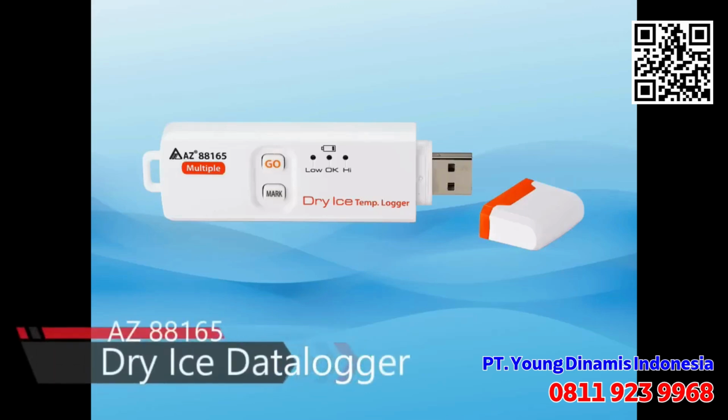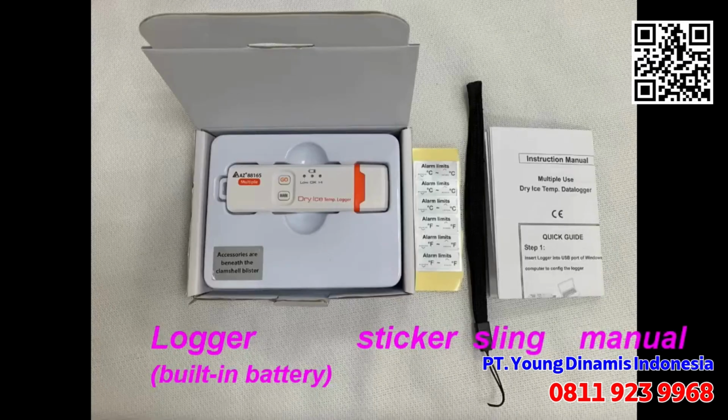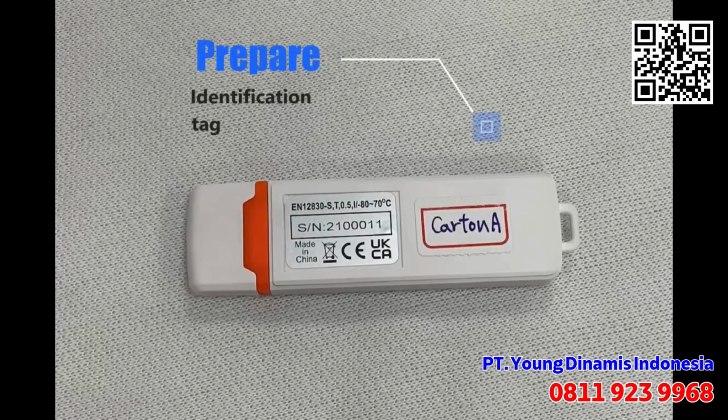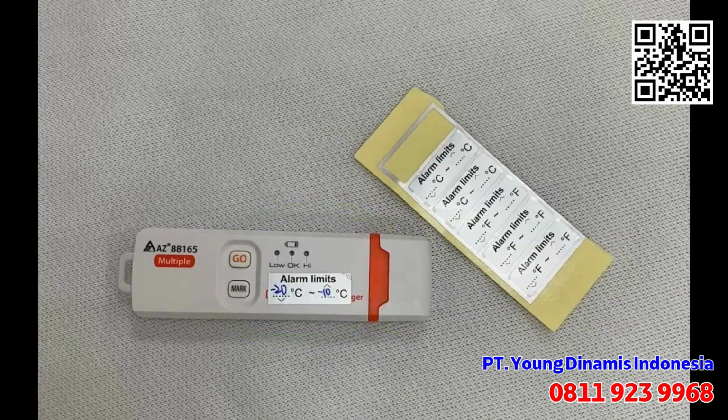AZ88165 Dry Ice Data Logger. Dry Ice Logger, Alarm Limit Sticker, Sling and Manual are included. Prepare an identification tag to give each logger a readable ID. If alarm reminder is required, write it on provided sticker and attach to logger.